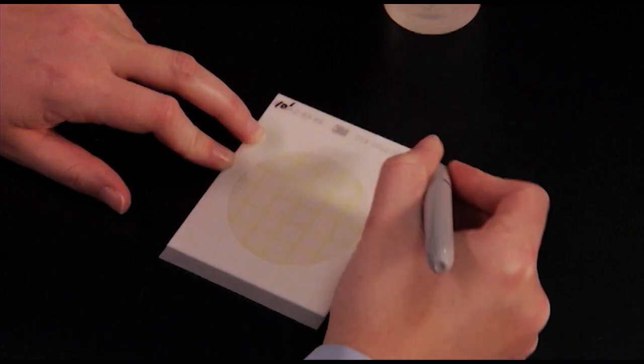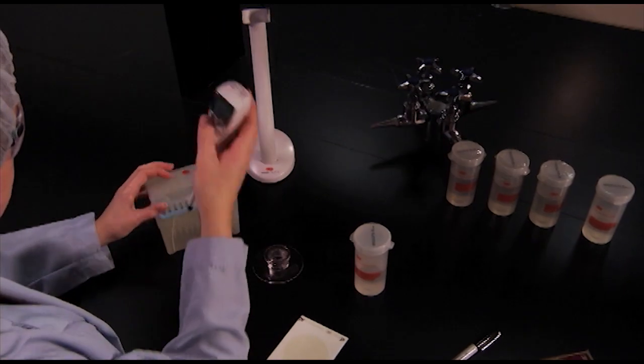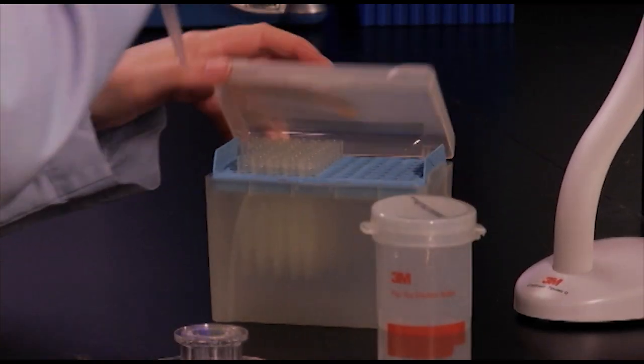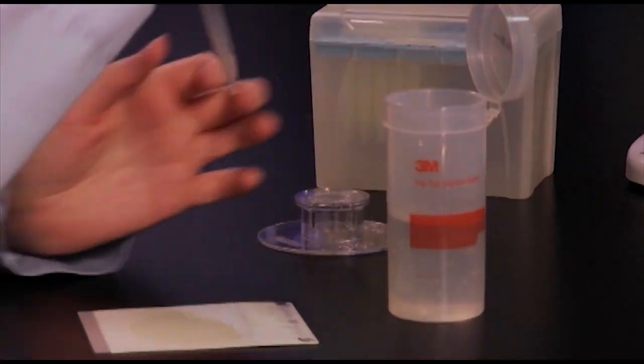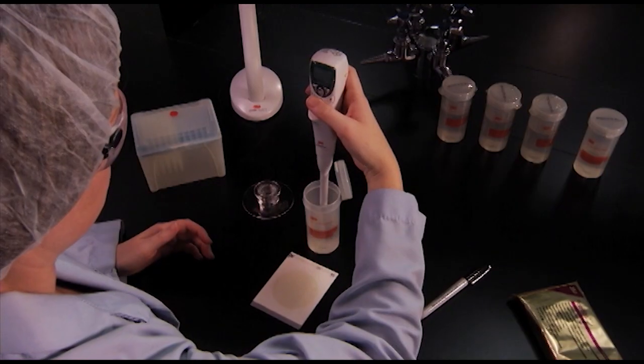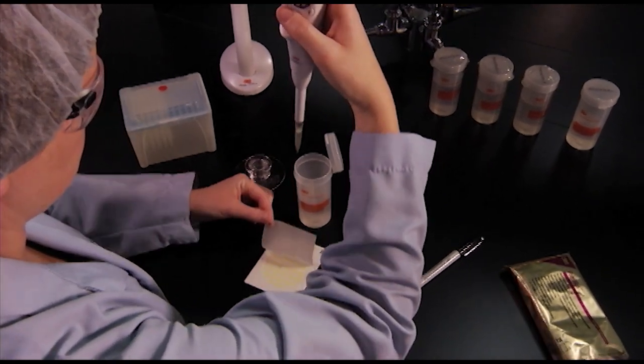Label the plate and place it on a flat surface. Then, attach a tip to your pipetter. We're demonstrating with 3M's 1 mL electronic pipetter and tips, a pre-programmed instrument for diluting and pipetting onto 3M PetriFilm plates.